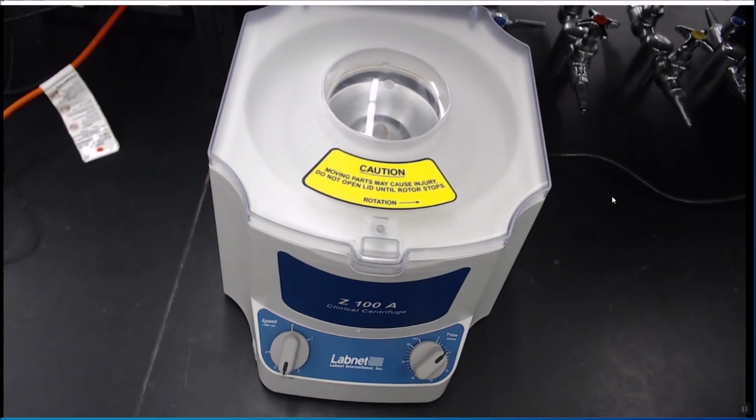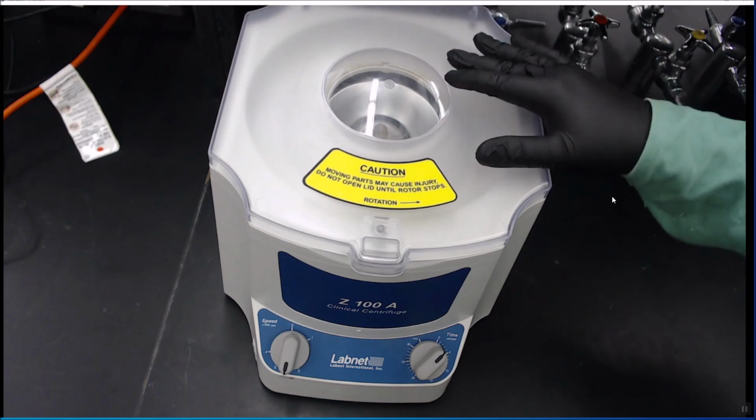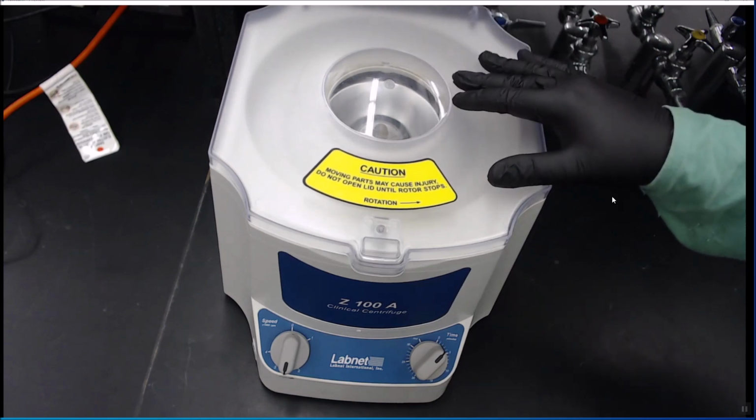So you've done a lot of chemistry so far. You have dehydrated your copper sulfate. You have performed a single replacement reaction where you extracted the copper from solution using magnesium metal. And now you are going to spin this down, and you are going to isolate your copper powder.